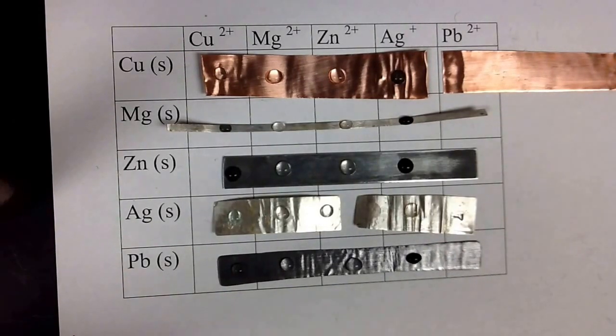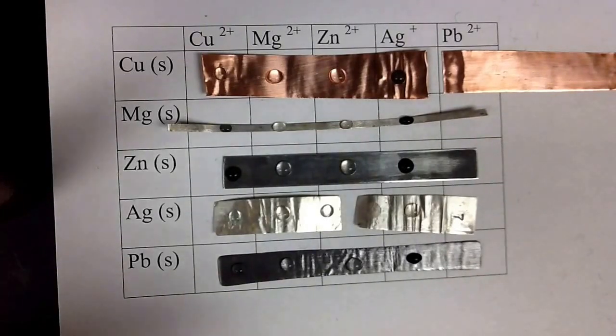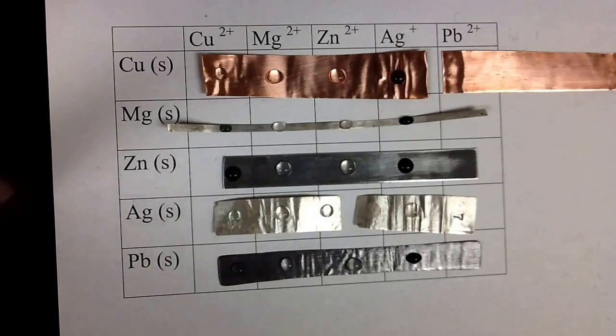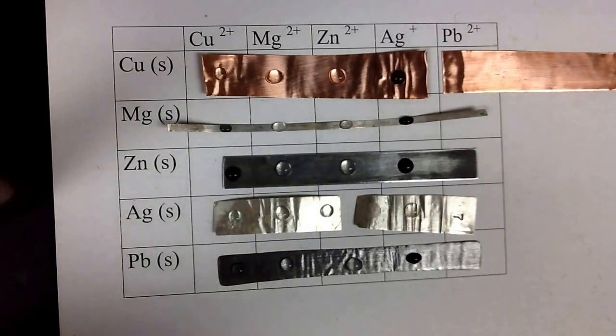And the magnesium ions. Oh, not the magnesium. I'm sorry, the lead. The lead is what I want. I got the wrong bottle, but here we go.